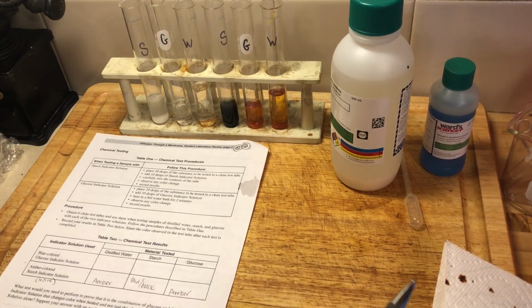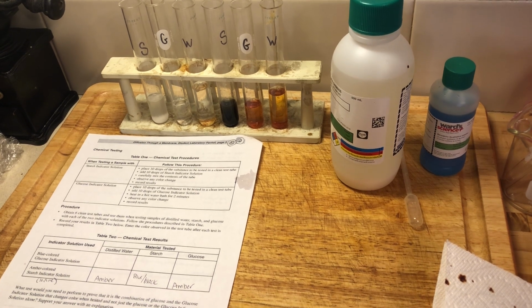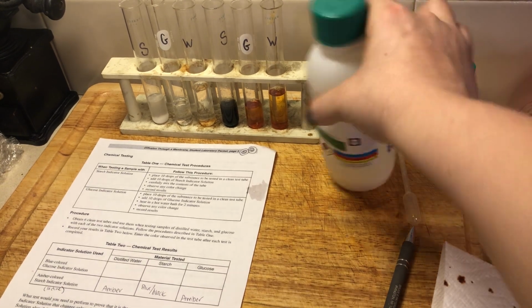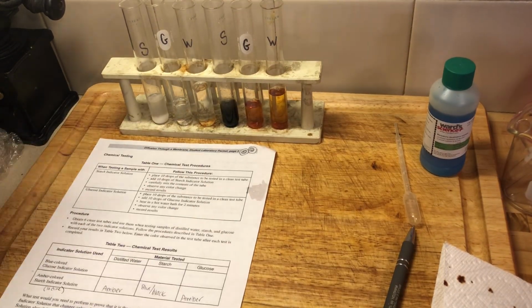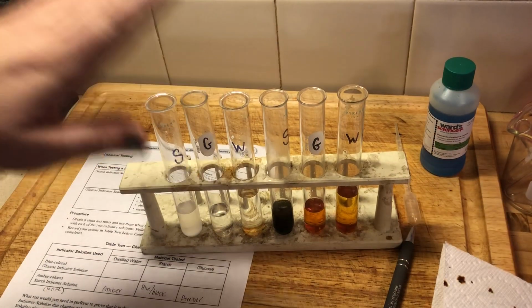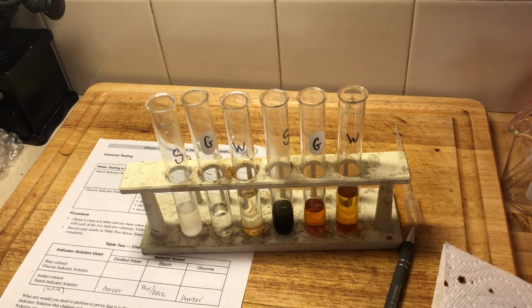All right. So it seems like my water is almost boiled here, ready for our Benedict solution, or our glucose indicator. So what I'm going to do here is I'm going to add my Benedict solution to my 3 test tubes right here, the 3 we have not used yet. And then we're going to, because Benedict solution needs some heat to work, I'm going to heat it up for a minute.